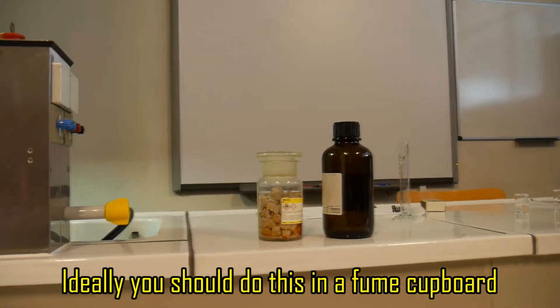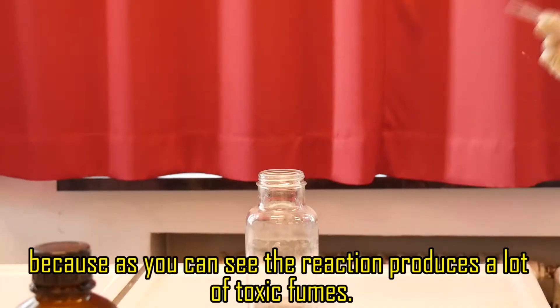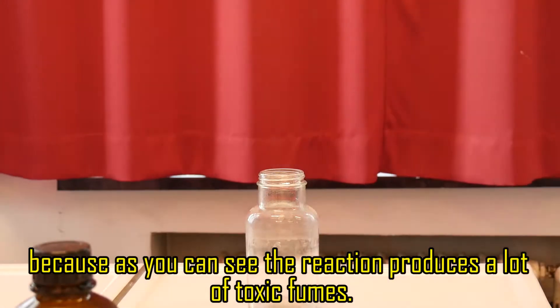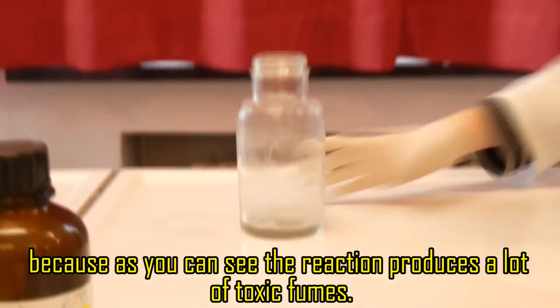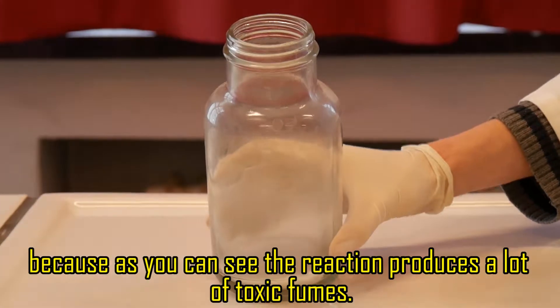Ideally you should do this in a fume cupboard because as you can see the reaction produces a lot of toxic fumes.